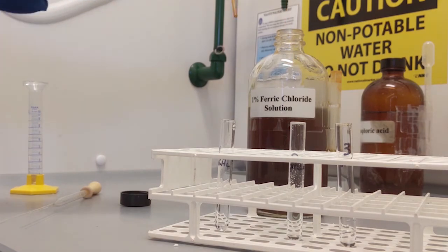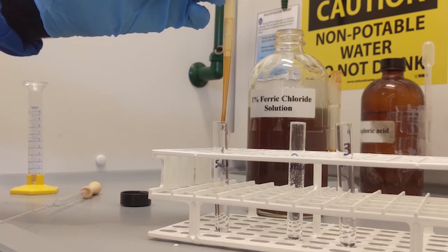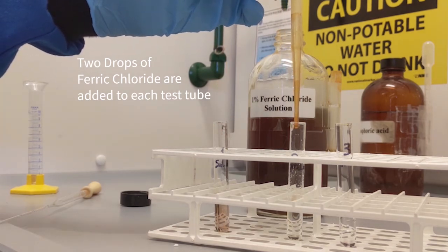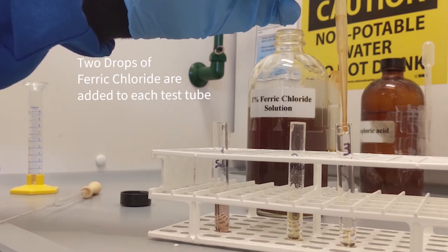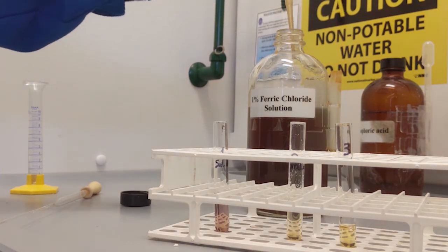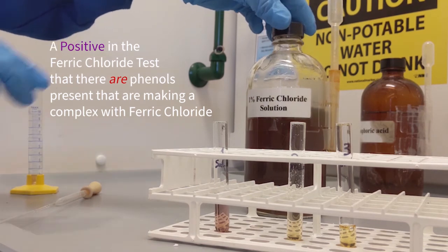Upon the addition of a few drops of the ferric chloride solution in each test tube, you will see a color in the salicylic acid tube, no color in your product tube, and a similar no color in your control. You can see the salicylic acid containing tube turned pink, indicating the presence of phenols, whereas the tube that contains the product did not turn pink, indicating no presence of the starting material.